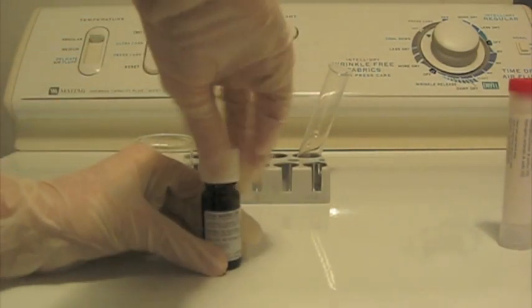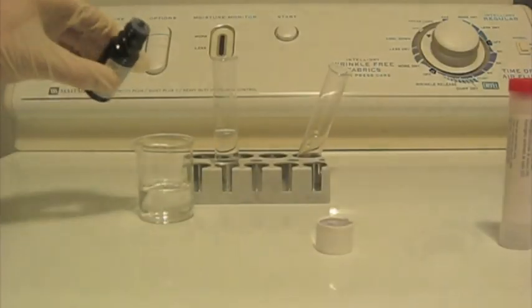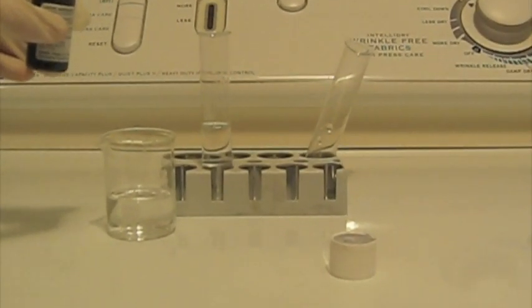This means that the hydrochloric acid I made is very weak. But I still made a slight concentration of acid.